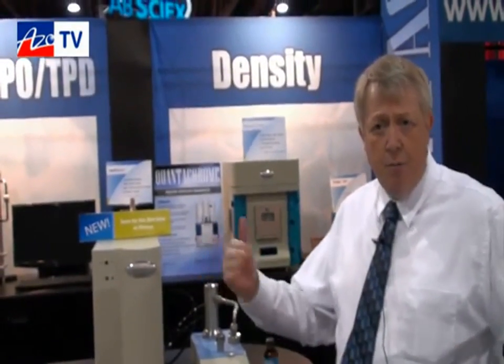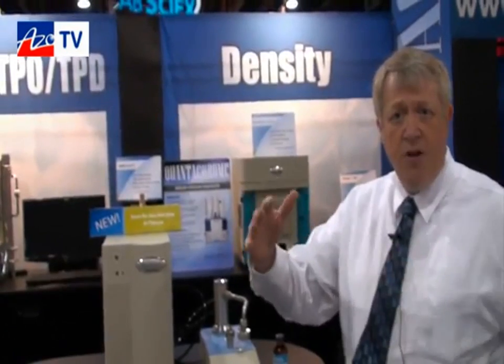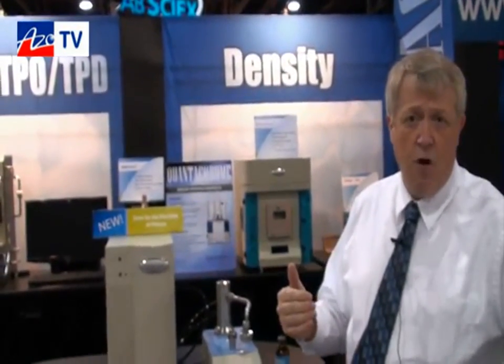they're making. These textured textiles, which are either woven or non-woven textiles, very often are made in broad sheets, and they need to be sure that the homogeneity of the sample can be determined across the width of the sheet and across the length of the roll.